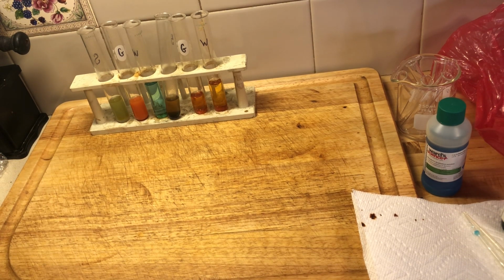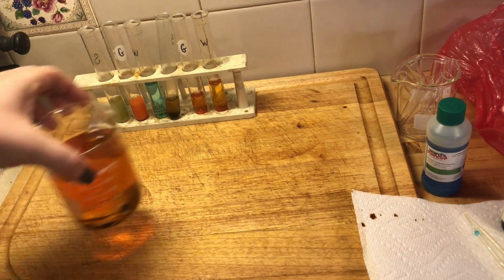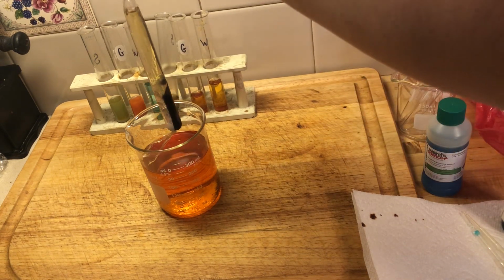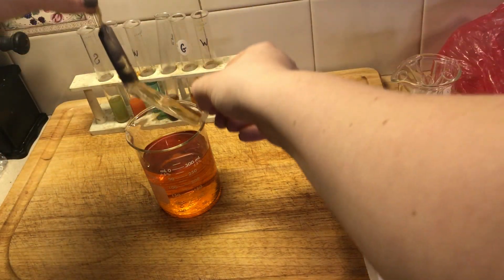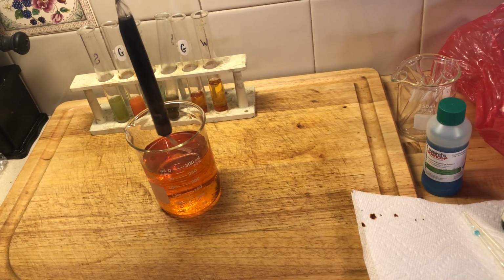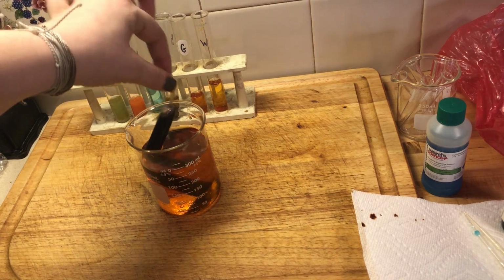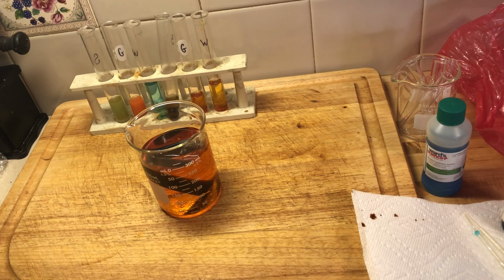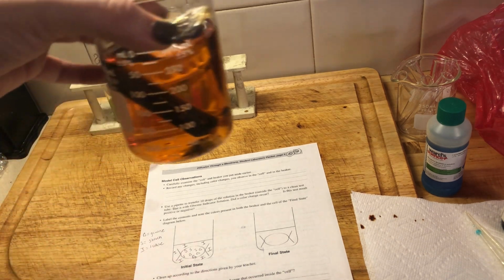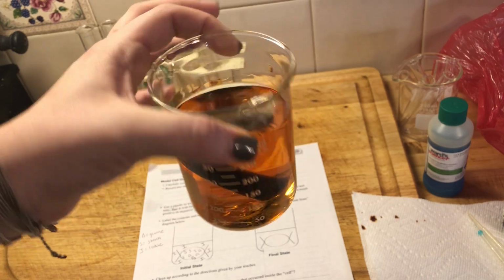All right, so let's see. We need to go back to our cell here. So let's take a look. Did we have a bit of a color change in our cell? Looks like we did, right? So this is not what our cell looked like when we started. We have a bit of a reaction going on here. Look at that. All right. So if we go back to page 4 of your packet, we are going to examine our cell in our beaker, which we did have a color change, right?